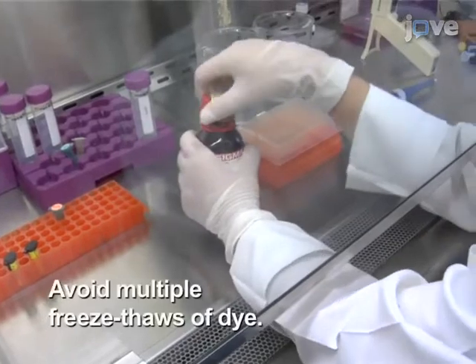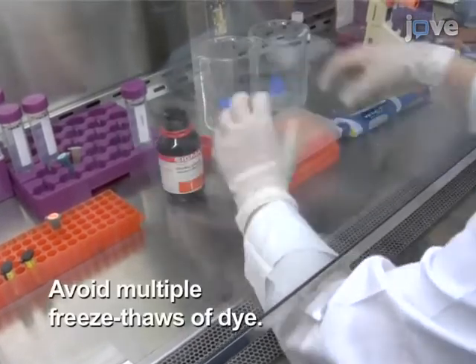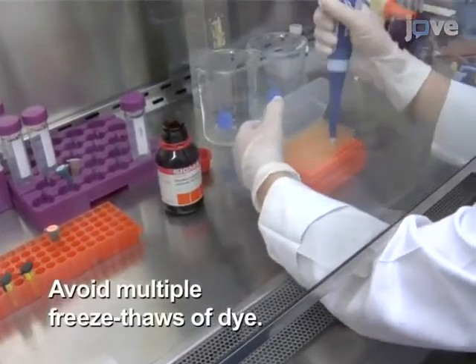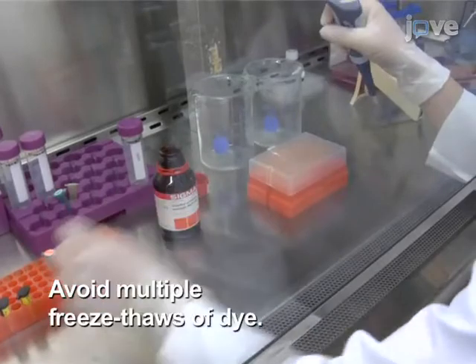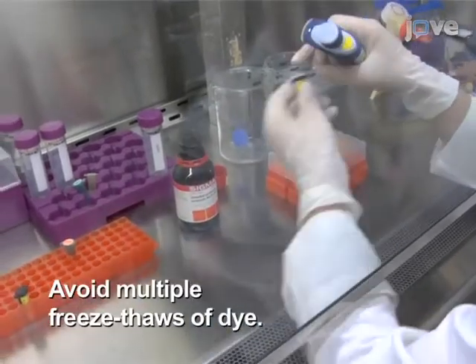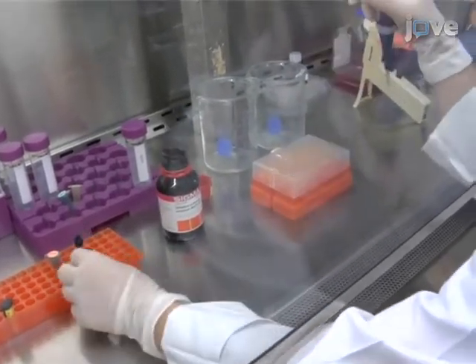Immediately prior to use, prepare a fresh stock solution of Carboxy H2-DCFDA in sterile DMSO or 100% ethanol.